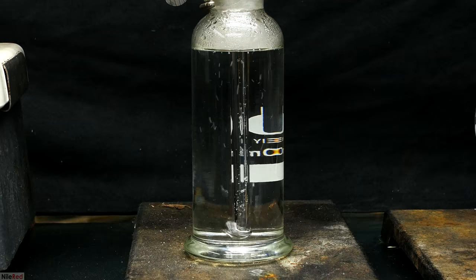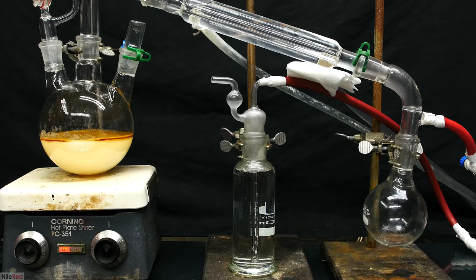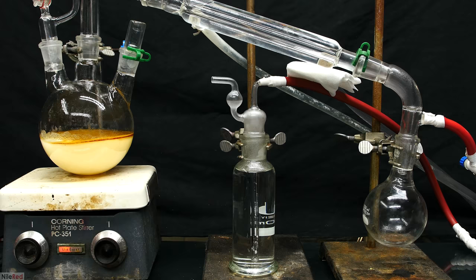As I approached the end, I was able to bubble the gas through extremely quickly. Eventually, the very last bit of sodium hydroxide solution was added, and now it's time to heat things a little.